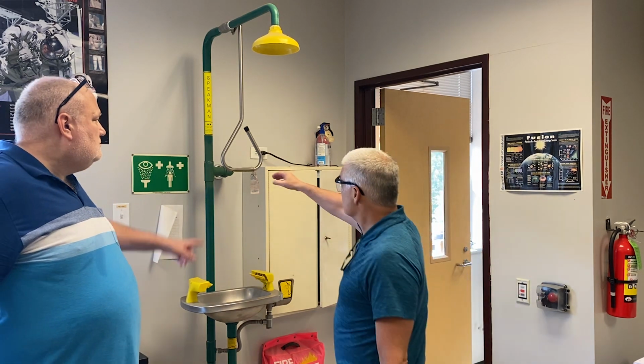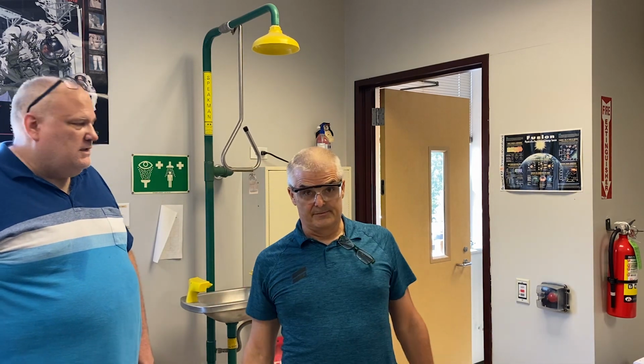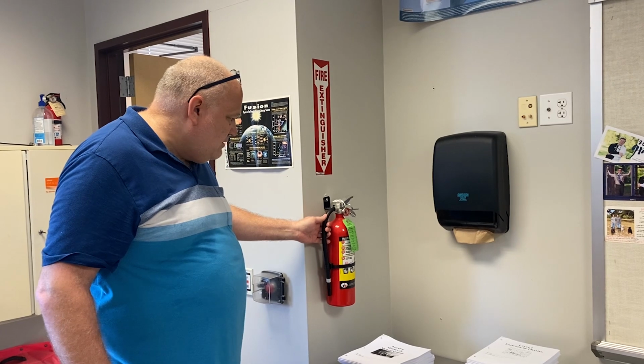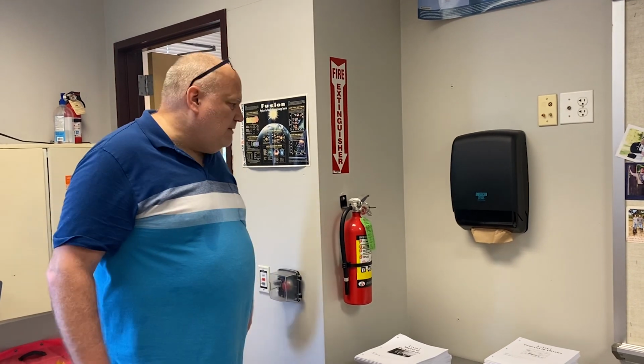You're going to see one of those demos as to why we're always going to wear our goggles. And if it were to spill all over your body, you're going to come over here, you're going to pull the shower, it's going to make a mess, but you're more important than a mess. Indeed. This is a fire extinguisher. If you ever have a fire, you're going to take this, aim the nozzle at the base of the fire, and try and put it out.